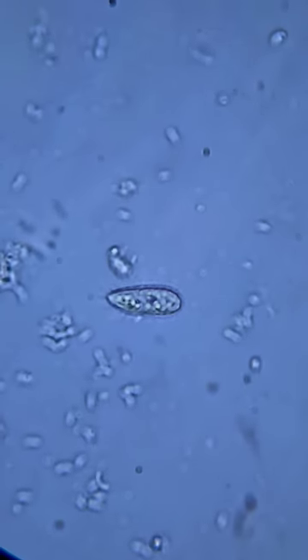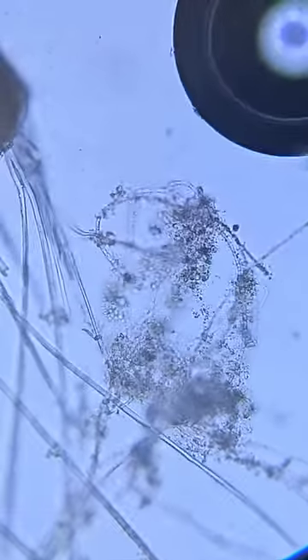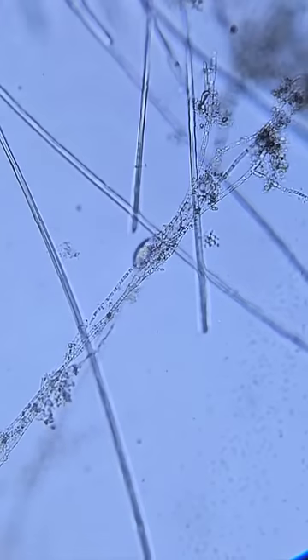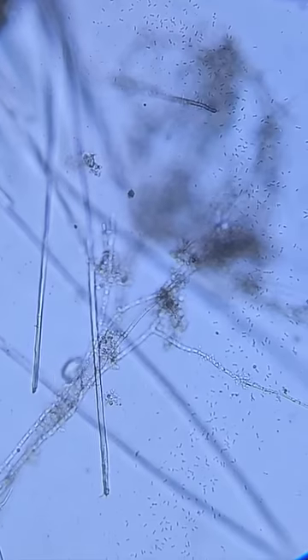I'm seeing all kinds of microscopic activity in this water. A little debris here and there, which is where I'm seeing most of the activity — lots of ciliates and bacteria. This little creature is crawling all over this piece of seaweed; trying to follow him but he's quick. And here it is compared to this grain of sand over here, so now you can see how small they are.